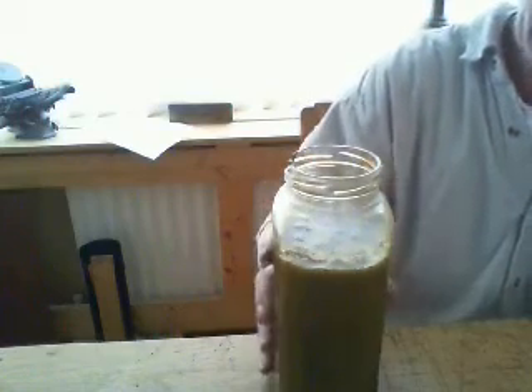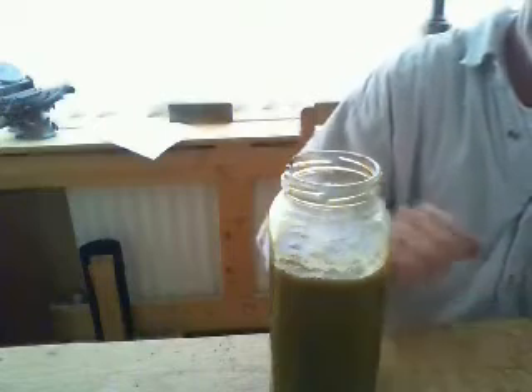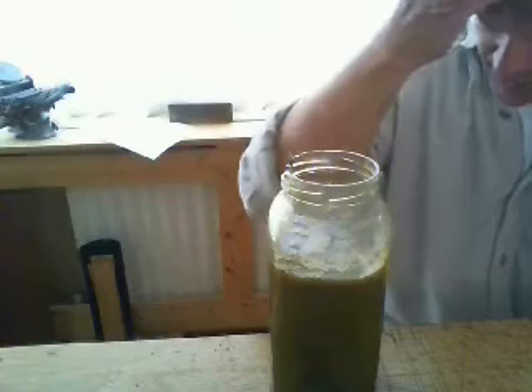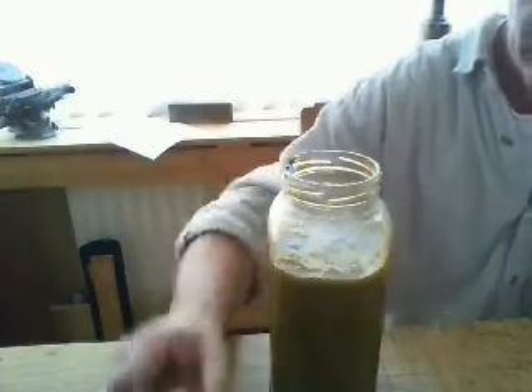Here it is after I've added the distilled water and hydrogen peroxide. It's got this kind of greeny-yellow colour, and this apparently is a suspension of the graphite oxide with all the other reagents in there. What I need to do now is get that out. The thing I was reading said to filter it, but looking at it, it's pretty gelatinous and I don't think it's going to filter particularly easily. So what I might do is centrifuge it out, then wash it, centrifuge it, and wash it.